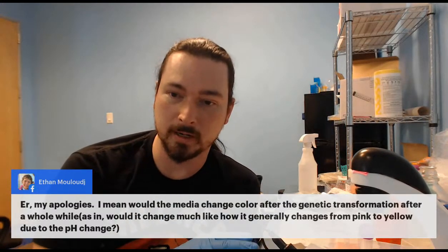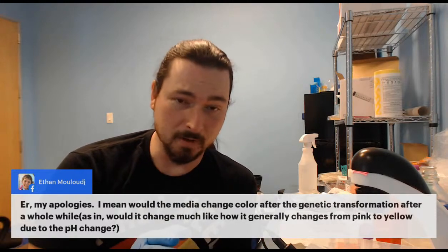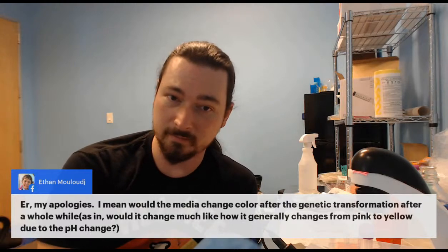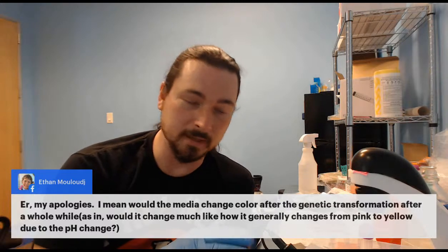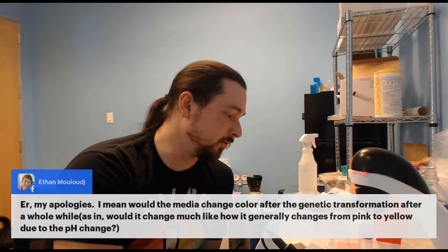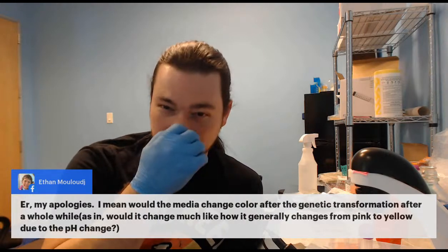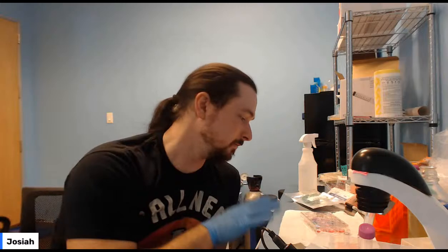You should see a really bright blue, and your control wells will still be pink. If your control wells turn blue, you probably mixed your tubes up. If all your wells stay pink, you messed something up and you got some kind of an error. So just make sure that you don't add DNA to your controls. But it should be pretty obvious. That's why I wanted to make this change to the kit, because I wanted to make it really obvious with a really strong signal.